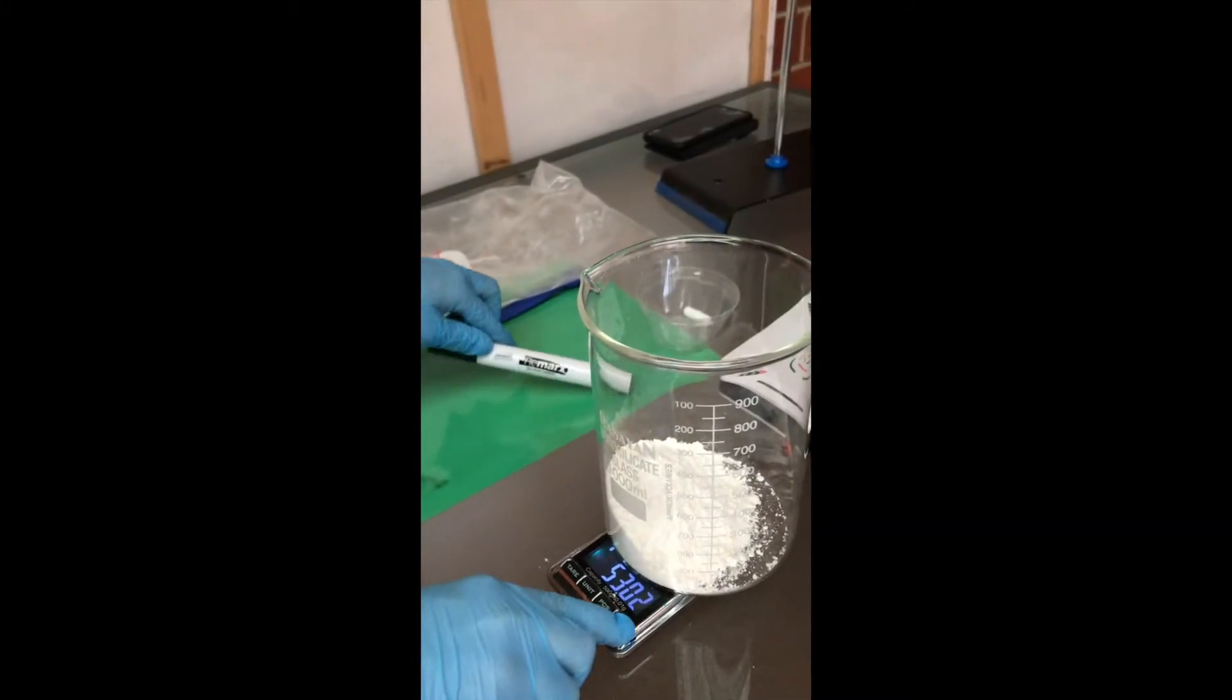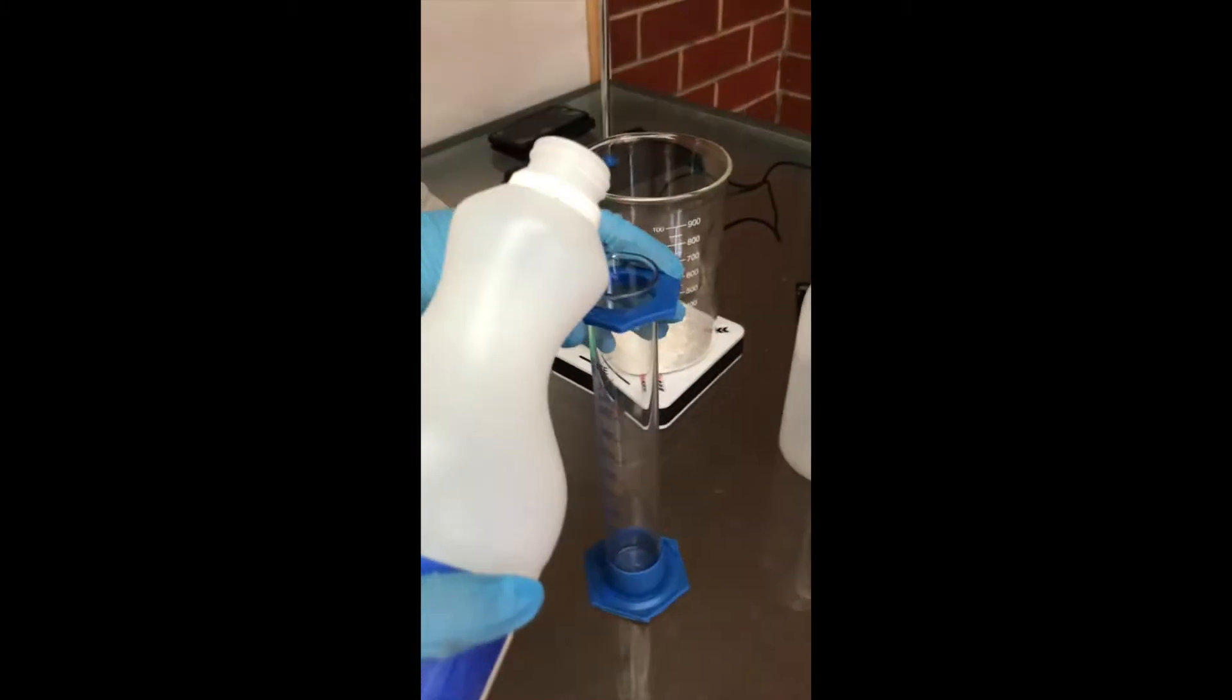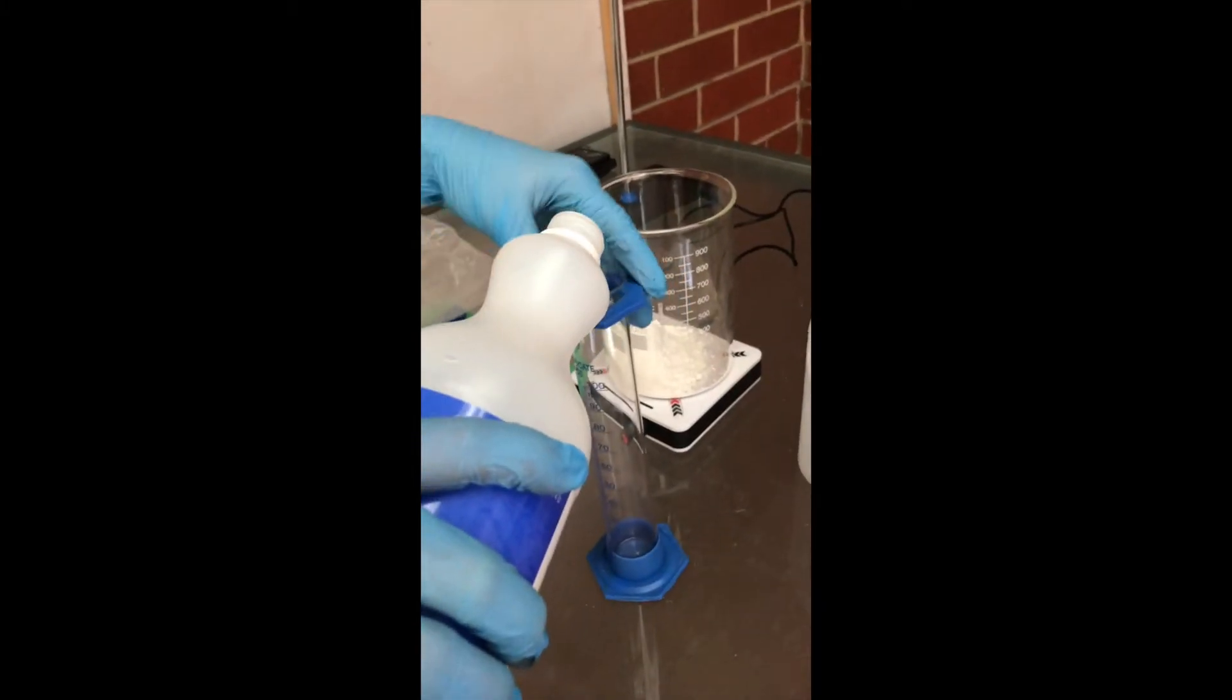I have 53 grams of reactant. I am now going to dissolve that in around 300 milliliters of distilled water.